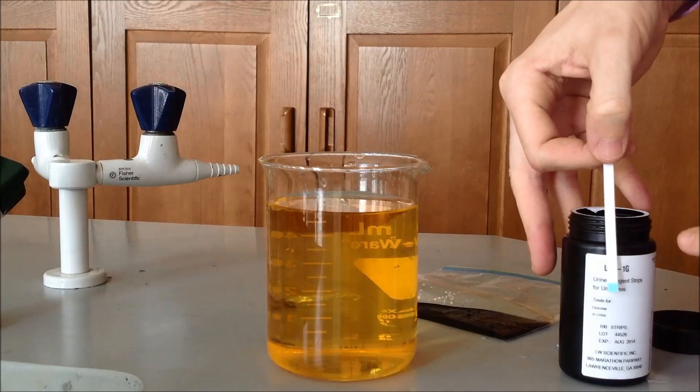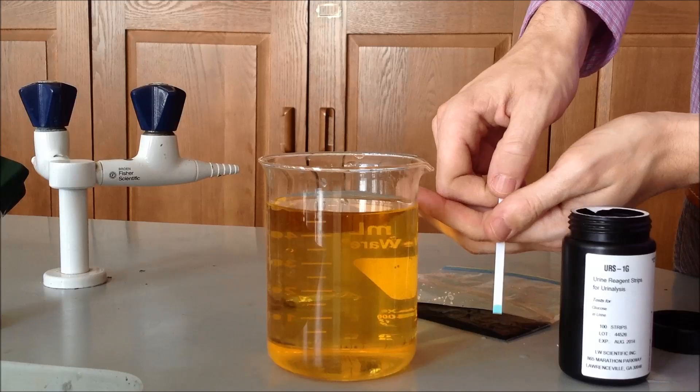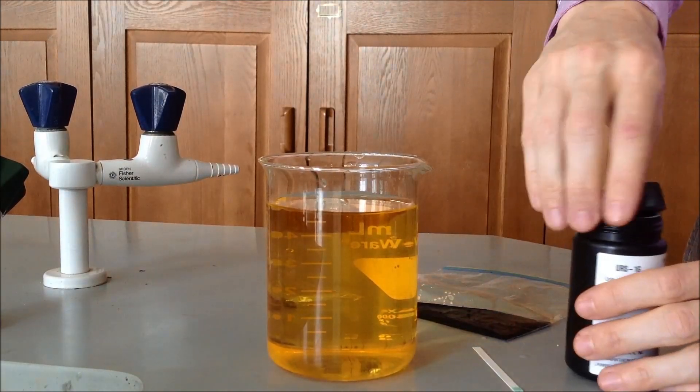For the results of this, we'll actually take one that's been tested and compare it to one that hasn't been tested, so you have a control to compare. So we let that sit for about 30 seconds.